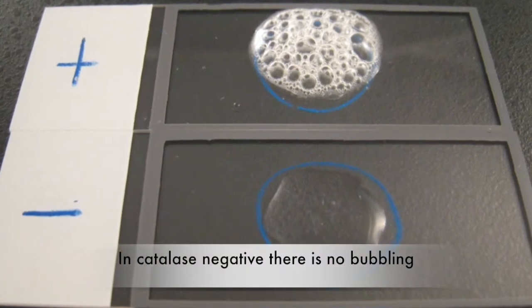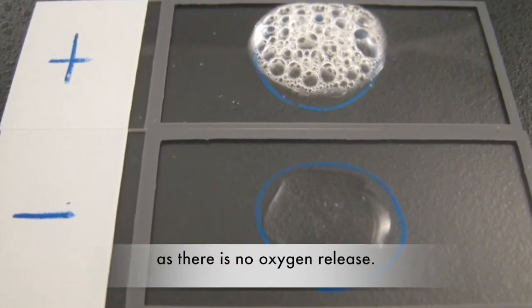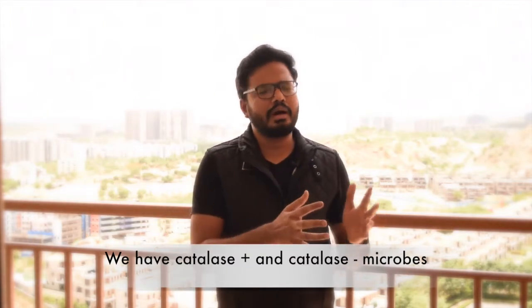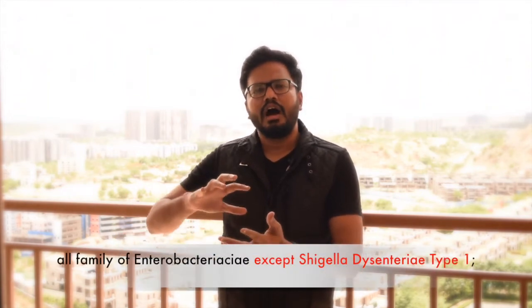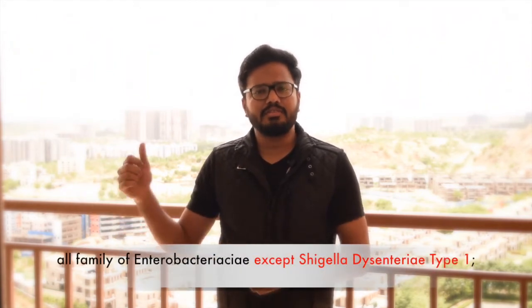In a catalase negative test, there is no bubbling as there is no oxygen release. Catalase positive microorganisms include all species under Enterobacteria except Shigella dysenteriae type 1, as well as staphylococci and Micrococcus.